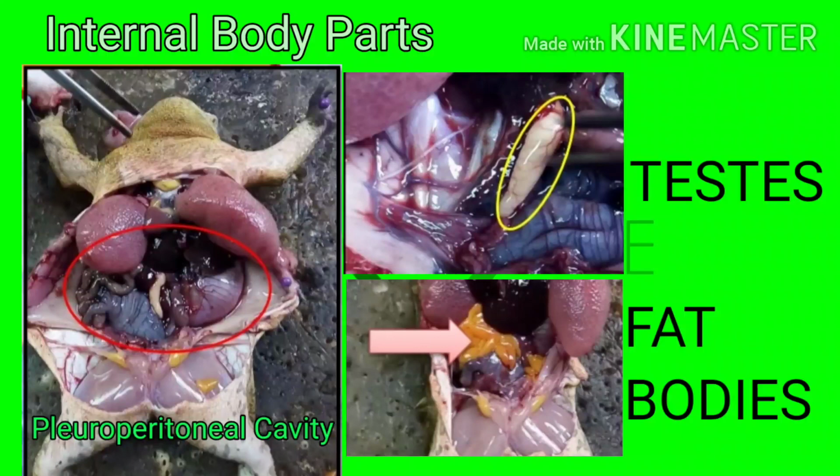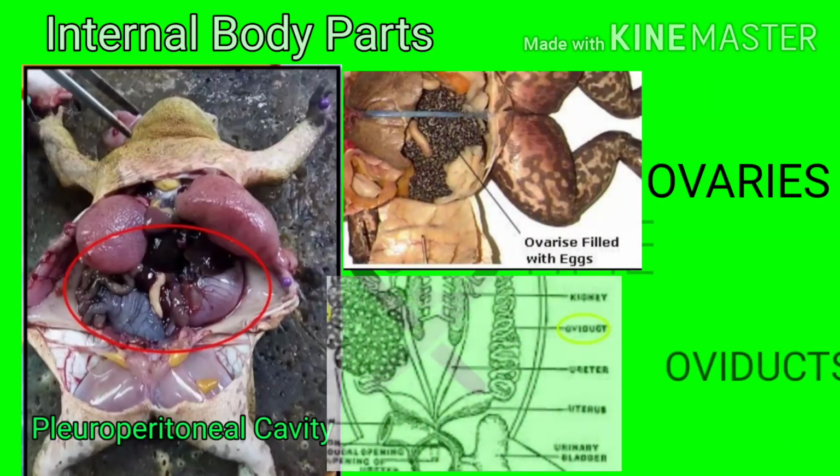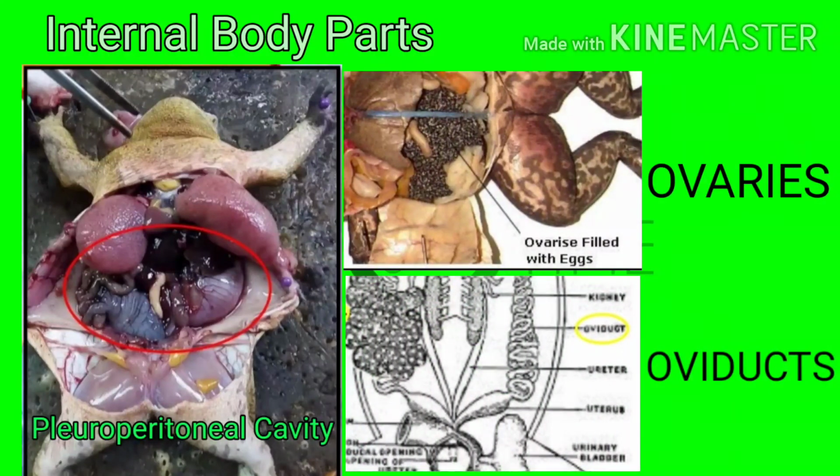While in females, they have the ovaries and oviducts. Ovaries are the dark organs attached to the ventral surface of kidneys that are sometimes filled with eggs. Without eggs, they become small, flattened, pale, and irregularly shaped. While the oviducts are the paired white coiled tubes lateral to the kidneys which carry eggs from the ovaries to the cloaca or the terminal part of the digestive tract.